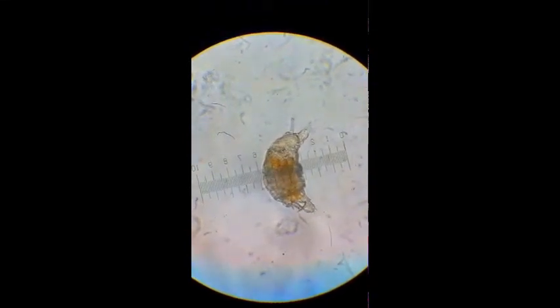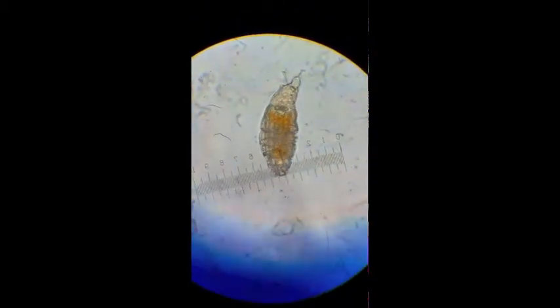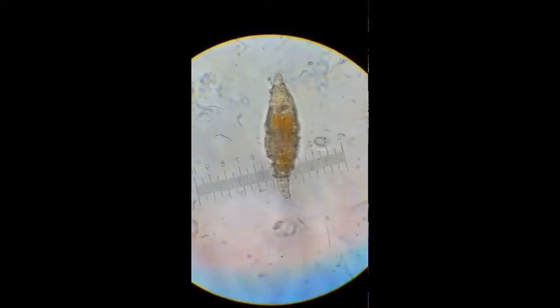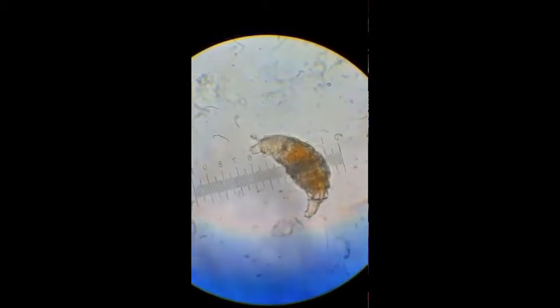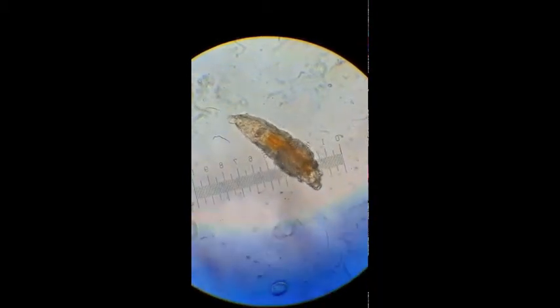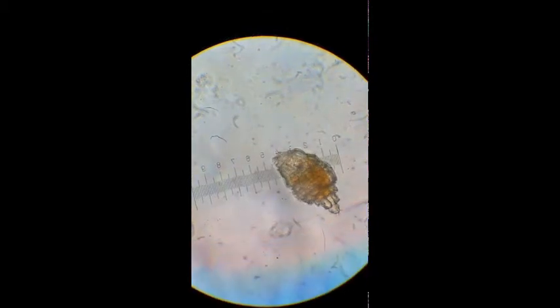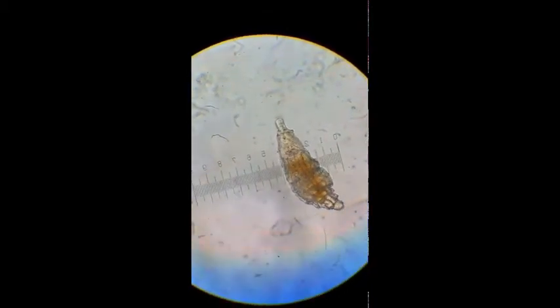They are incredibly interesting creatures, given their ability to survive utter desiccation by curling up their body into a tight tun form. As you can see, they can do this as their body is telescopic, so they've got three sections: a foot, a trunk, and a head, and these can retract inside itself to survive when the environment is completely dried out. They can then be rehydrated, which I've shown in another video, and then you can actually watch them come back to life, as it were, in real time.